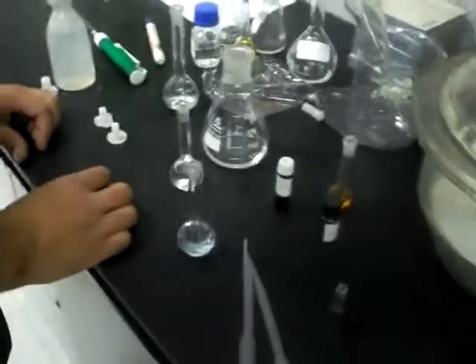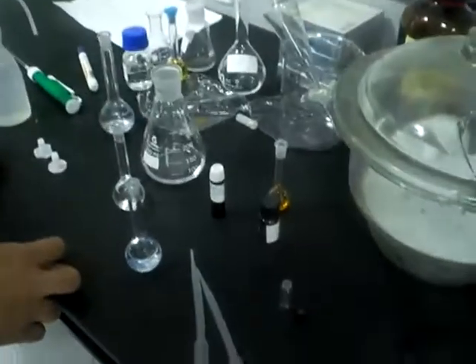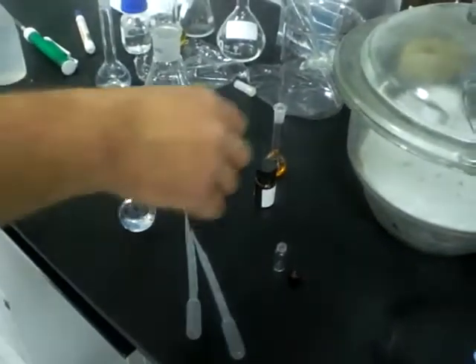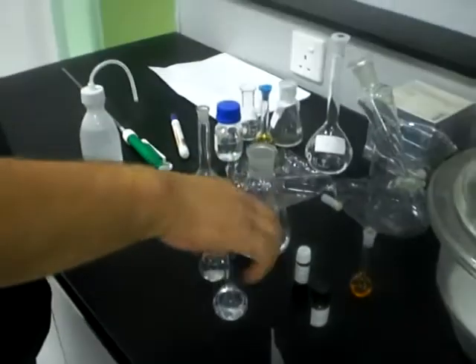Here our colleague will test the concentration of thujone as the active oil in sage extract. We have it here, this is the sage extract, and we want to know the concentration of it. We also have a standard, pure thujone, and we prepare two samples: the test sample, which is the sage extract in hexane, and thujone as a pure compound in hexane.